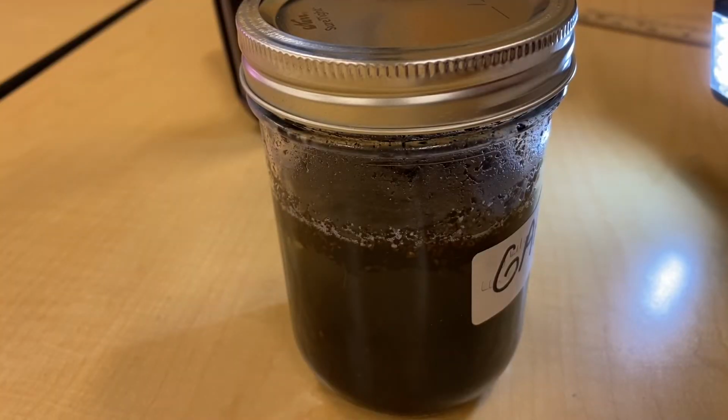Okay, our jars have officially sat for 24 hours. So we are going to come back to our main lab and do part 2, which is the observations of layers. You are gonna have a chart and analysis questions for both of the samples. First, we need to observe the layers that have formed and then describe them in the table. We're gonna try to identify the materials in each of the layers. And there is a key given to us with the letters O for organic matter, C for clay, ST for silt, SD for sand, and G for gravel.